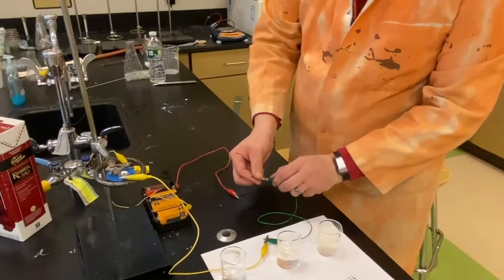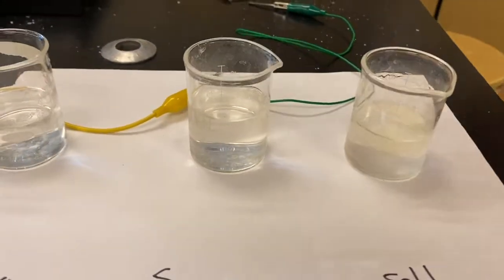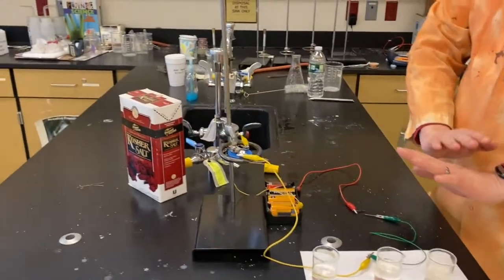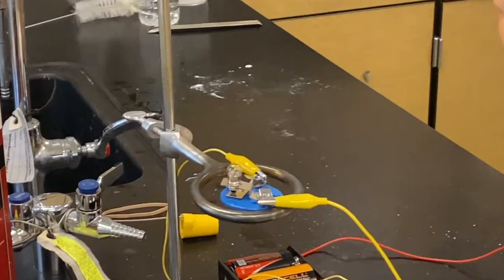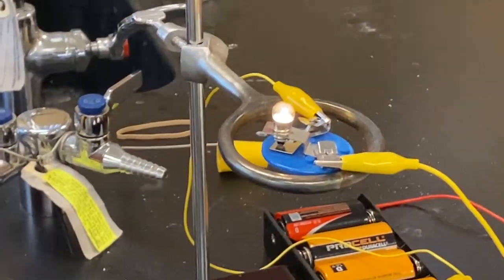Now we go to our last sample here. We've made up some salt water. So in the salt water here, we have these sodium ions, these chloride ions. They're now loose in solution. They allow the electrons from the battery here to flow through them. And we can see that with our light when we put in our probe. And now notice we're getting the passage of electricity.